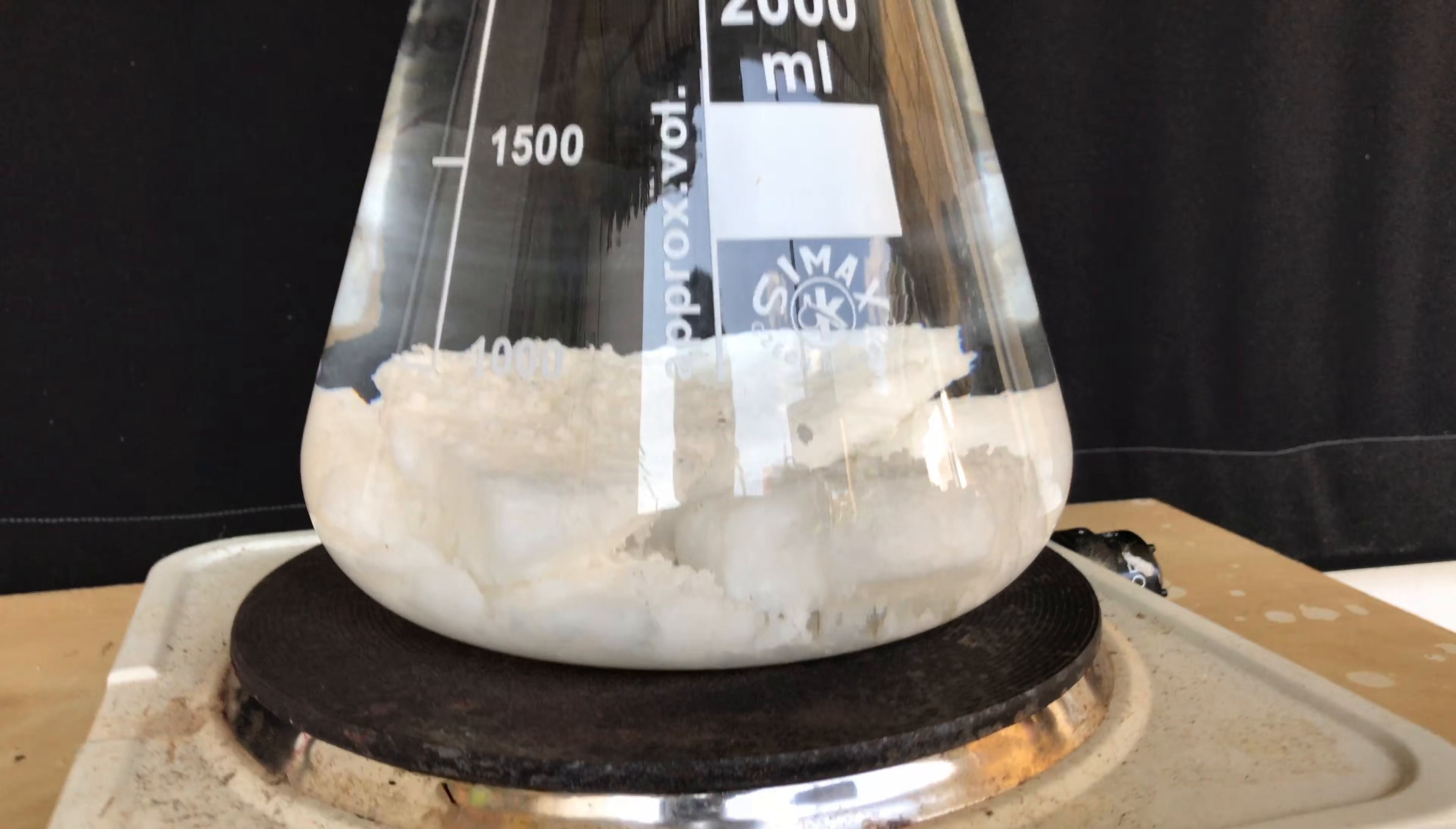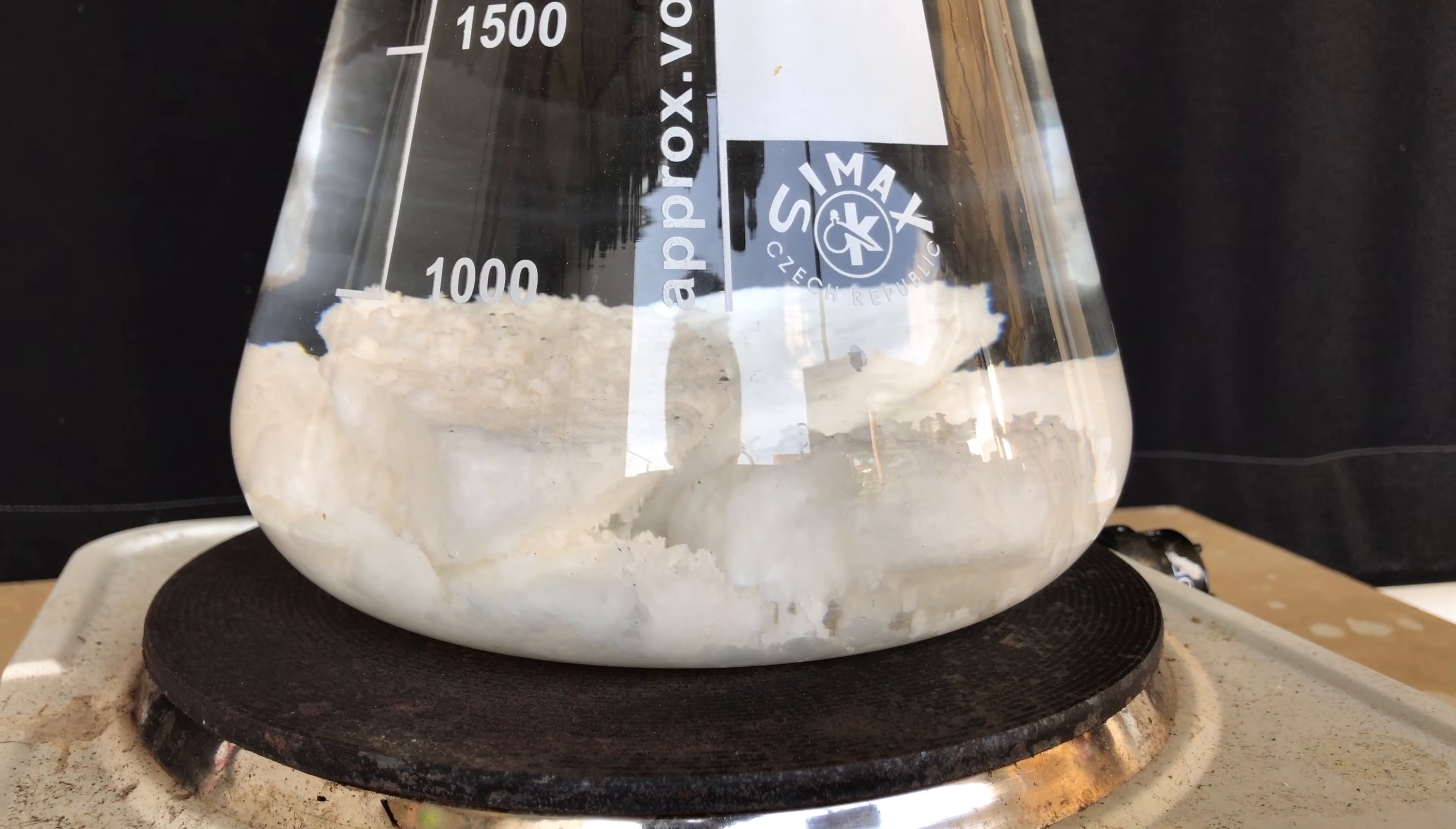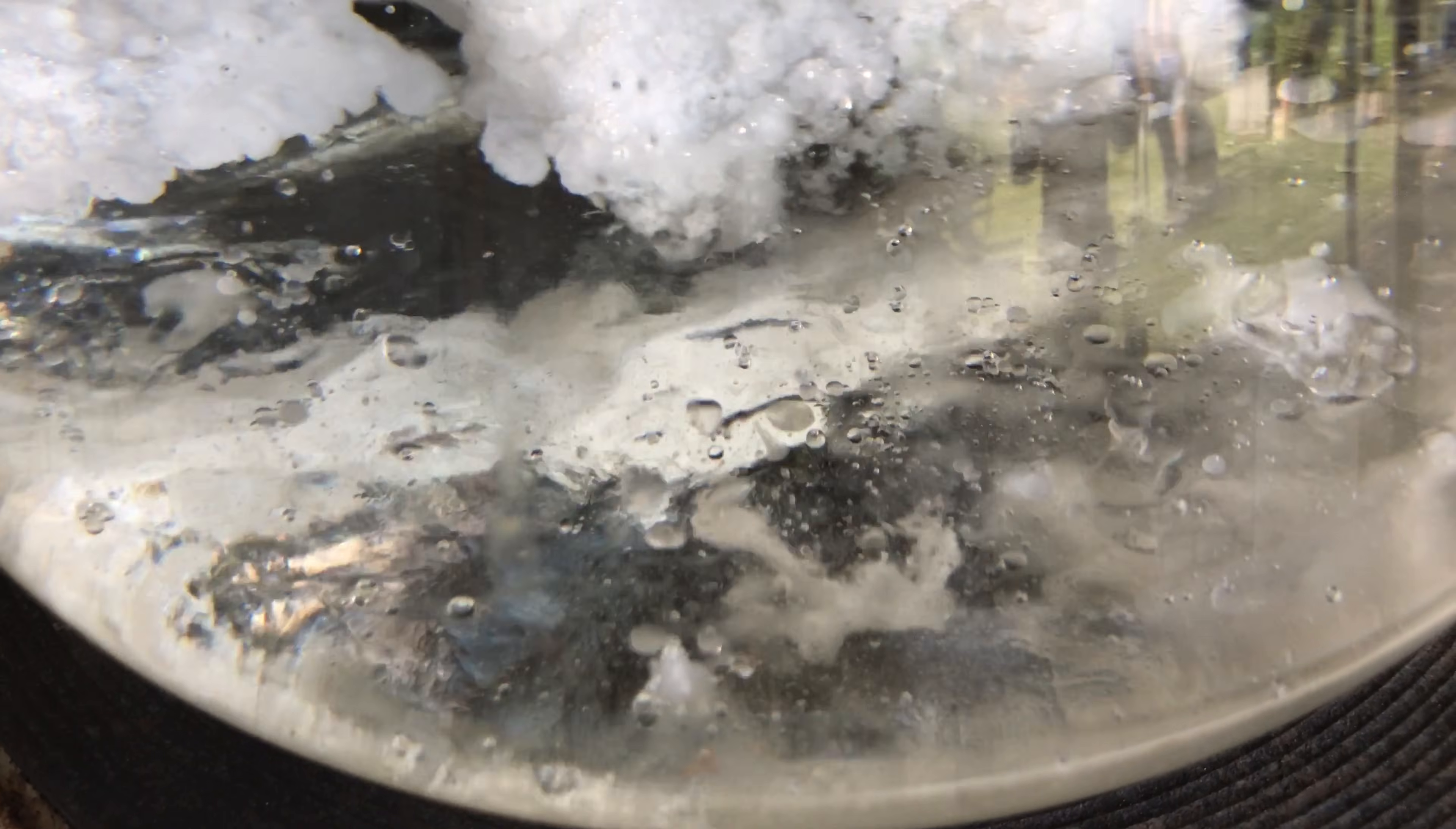I ended up using a lot of distilled water, heating it up, crystallizing it out and reusing the distilled water because there was so much benzoic acid, but while heating we got this very interesting lava lamp black looking effect.